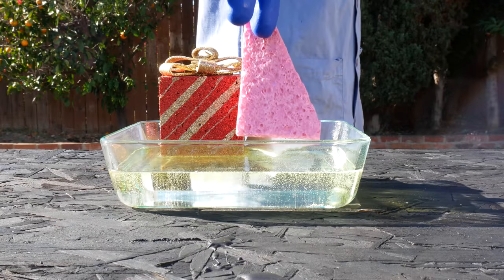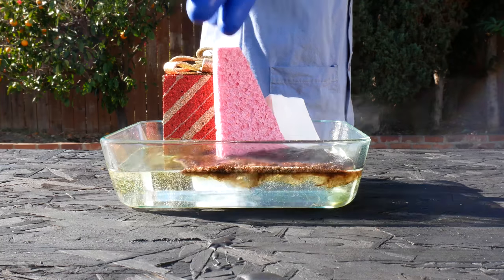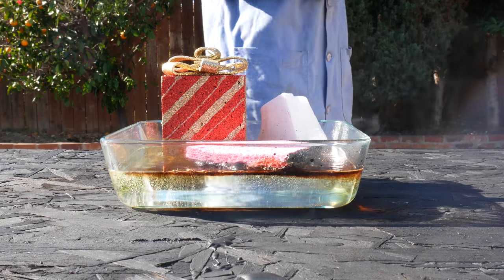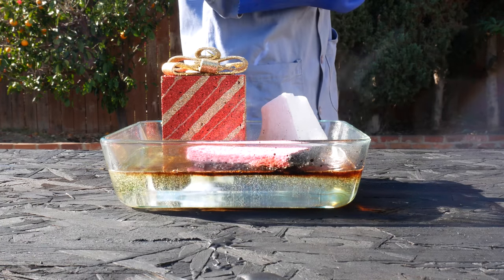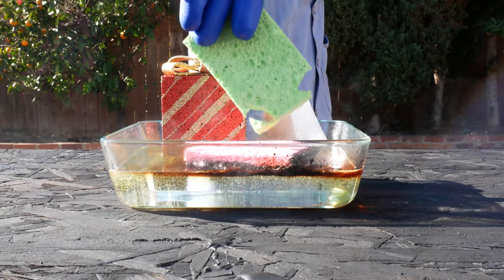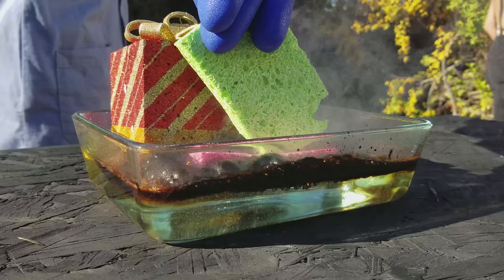Oh, there it goes! That's doing the opposite of cleaning, Nick! We're cleaning the sponge real well. You accidentally melted it! Oh, do you smell that? That's a strong fume! Oh my goodness! Get out of the breeze zone! Is this good for the nasal passages? That is not good to breathe.